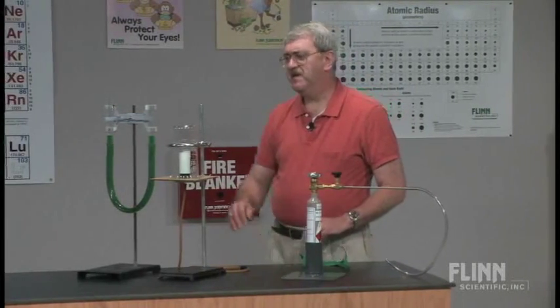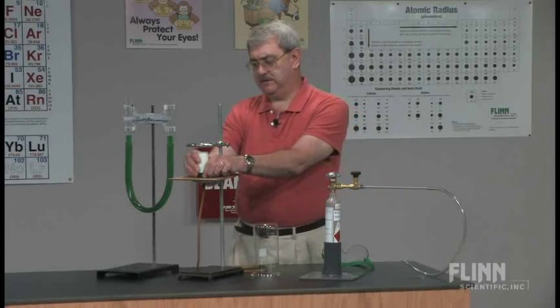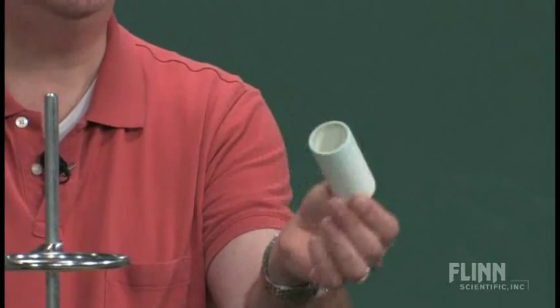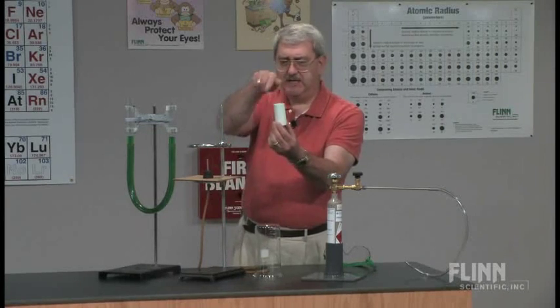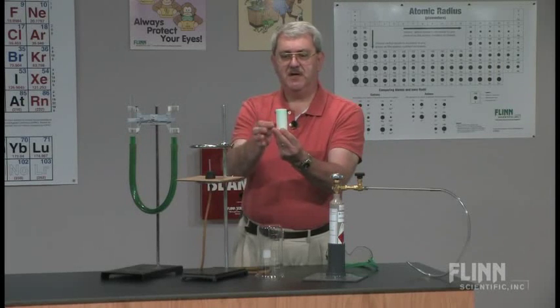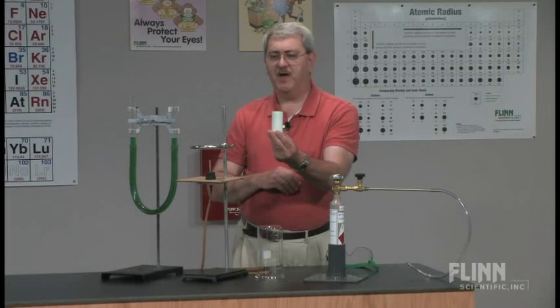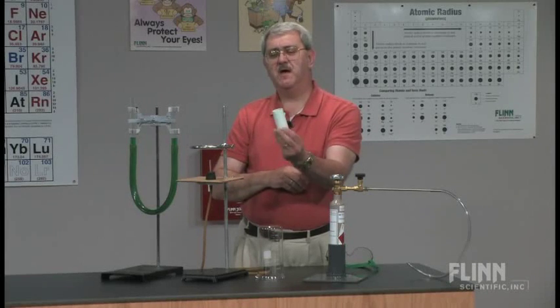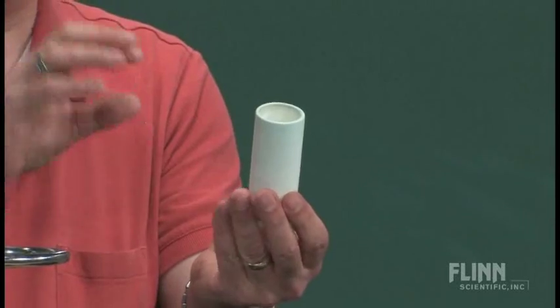Some other equipment that we have here is a beaker — a tall form, a liter beaker. It's attached and going over this apparatus. Now this piece of equipment is also going to be new to the students and may be new to you. It's a porous cup — it's like a flower pot but hasn't been glazed. It has tiny channels through it. If I were to put water in here, soon the cup would become wet on the outside. It's a container with small channels — not big openings, but very tiny ones.